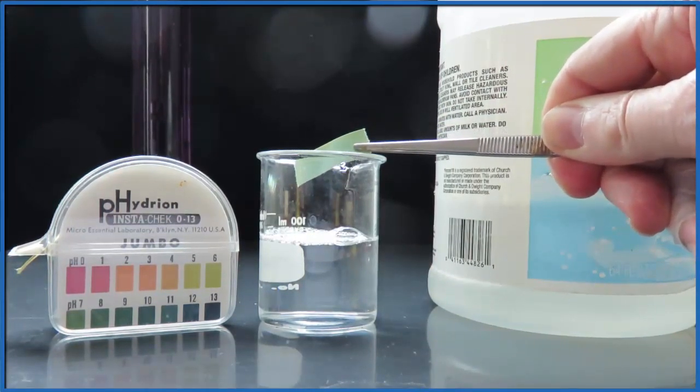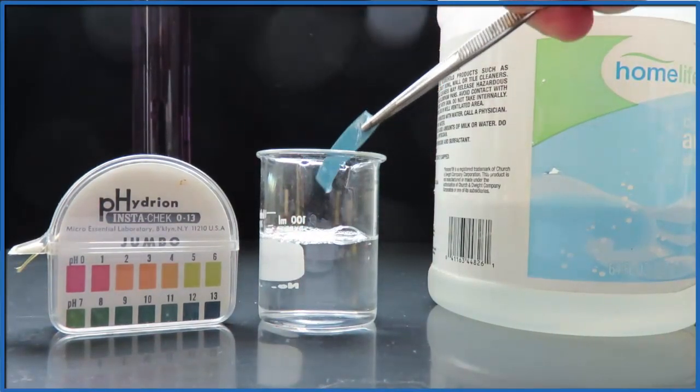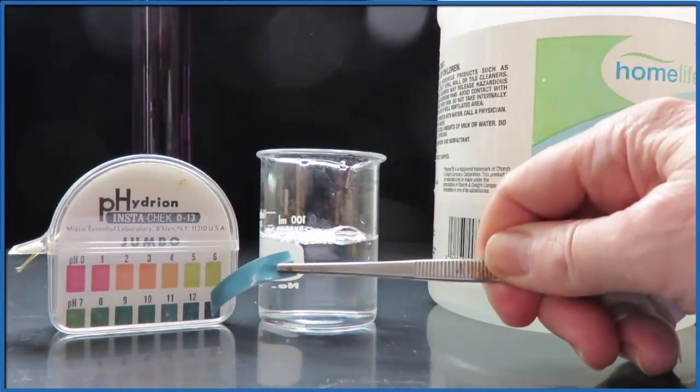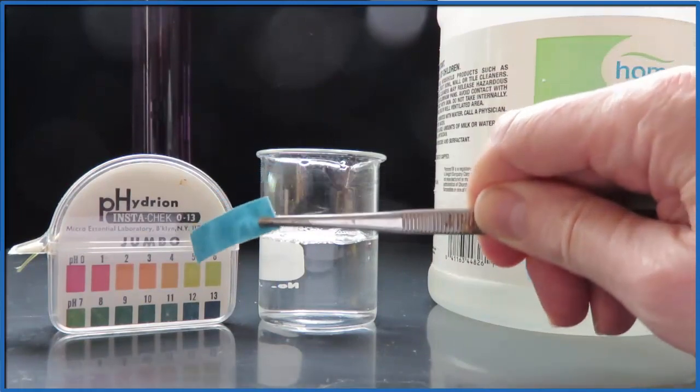If we take it and put it in the actual solution, it turns dark blue. We hold that up to our key here and we see the pH is right around 10 or 11.